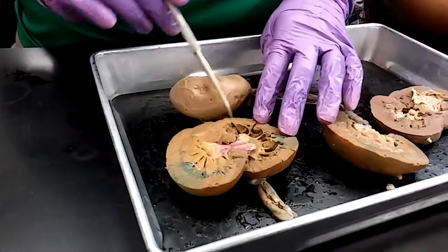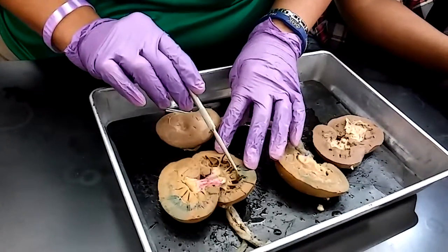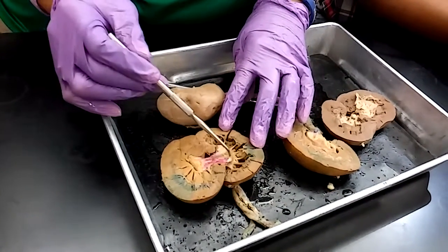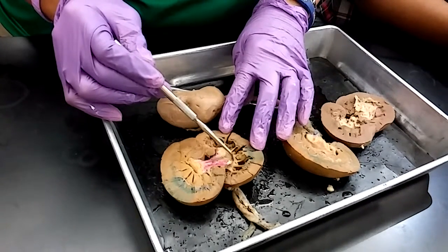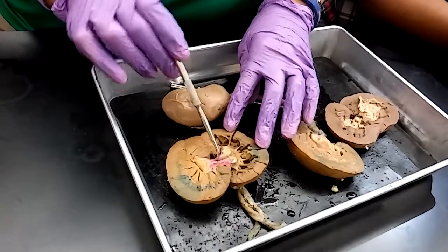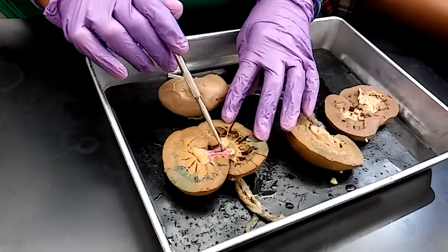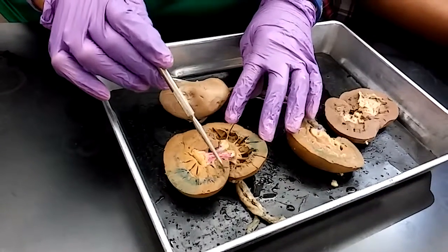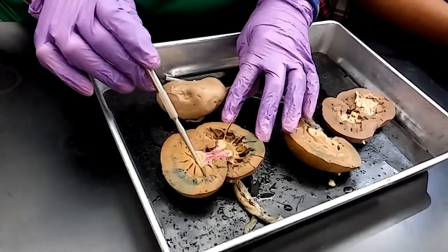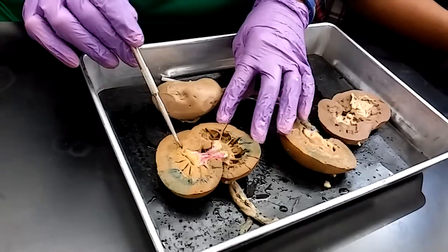Make sense? Now, in this deeper view, if I stuck a pin in this, or this, or this, or this, you would tell me that those are minor calyces. If I stuck a pin here in this area, you would tell me that it's the major calyx. If I stuck a pin here close and leading into the ureter, I would want you to tell me that I'm in the renal pelvis. Make sense? If I asked you specifically what part of the kidney this is, you tell me that it's the cortex. If I said what part of the kidney is this, you would tell me that this is the medulla. Does that make sense?